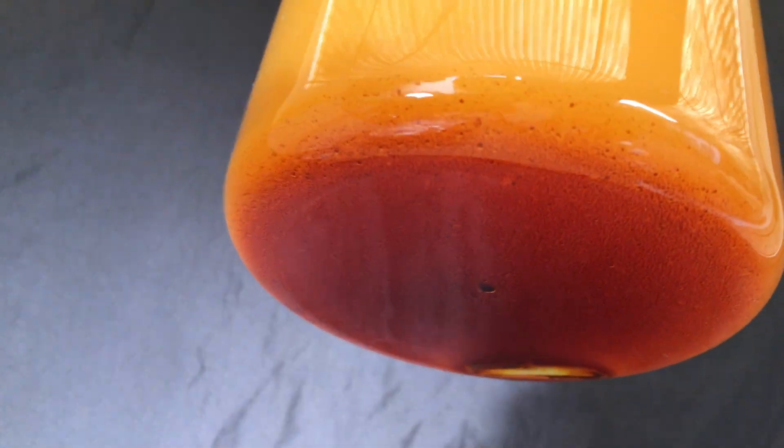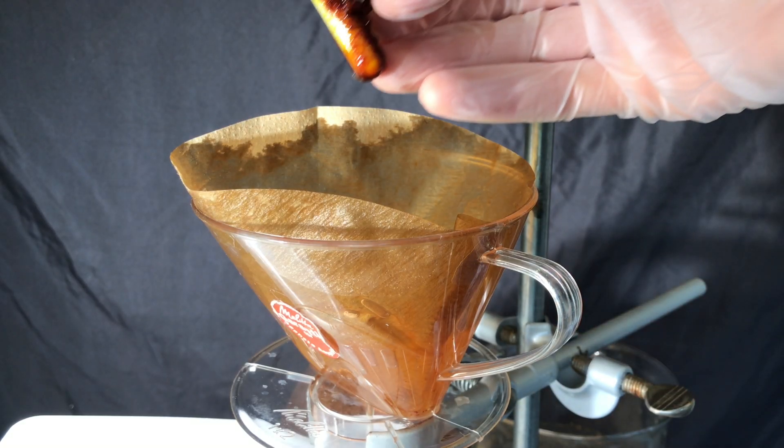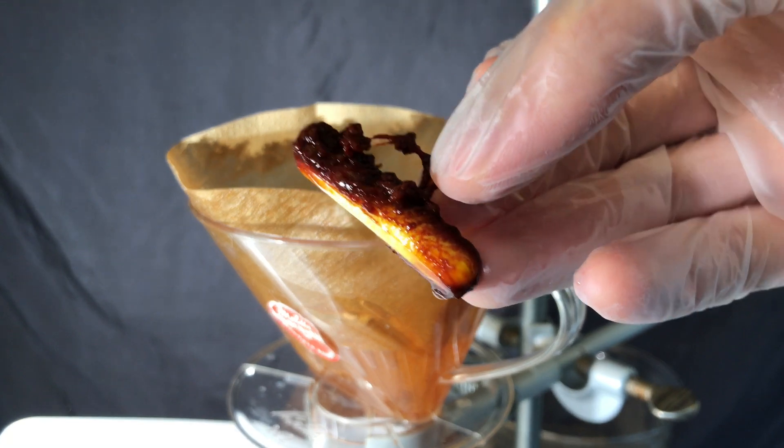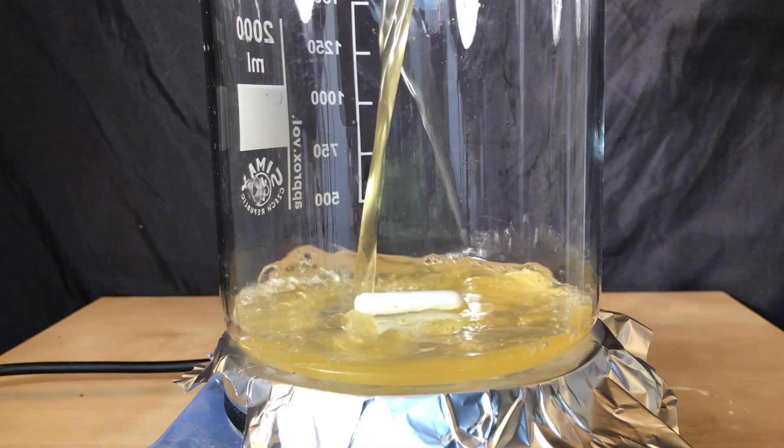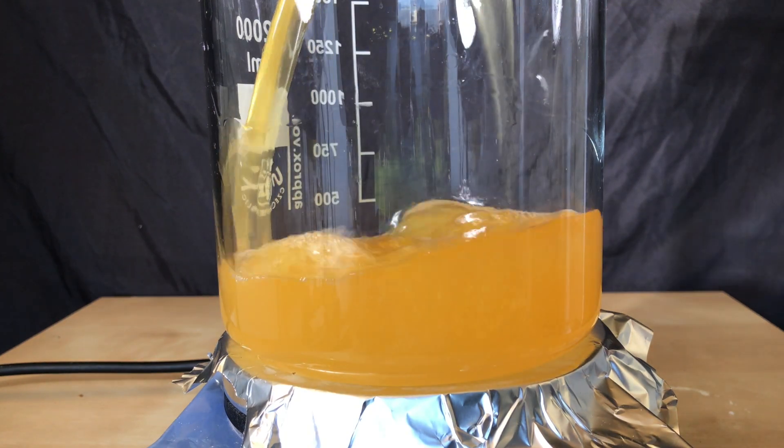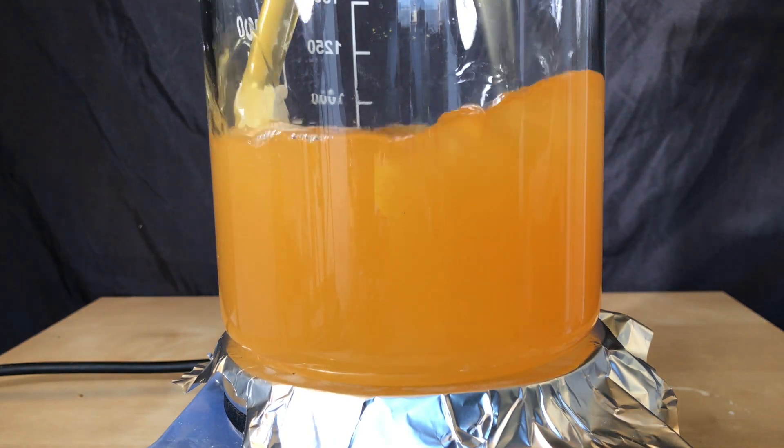The contamination might be leftover benzoin, but it could also be benzhydrol. A gravity filtration was performed to get rid of the solids, and as you can see our stir fish caught some sort of disease. The solution was then poured back into a now clean beaker. As you can see it does not look clear but it looks cleaner.